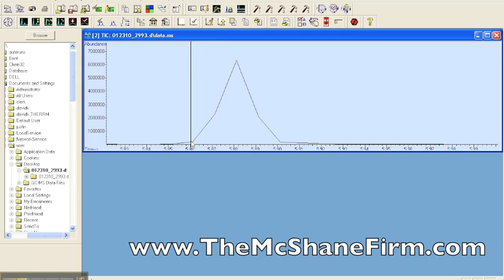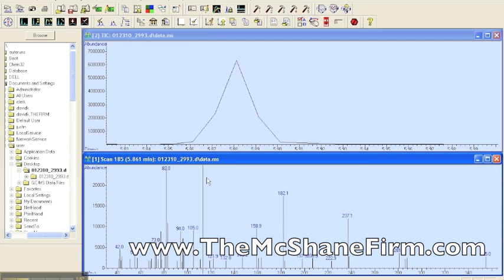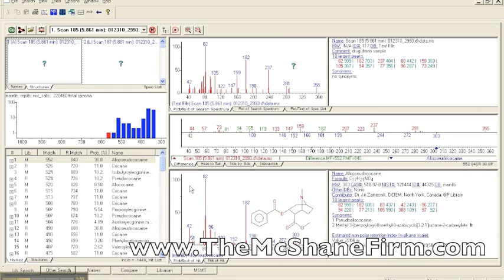So let's take some extreme positions. Let's say you're an analyst and you right double-click down here where there's clearly a peak and the beginning of the compound. We right double-click, and that comes up with the scan that's down below here. The next thing we do is right double-click to open up the NIST spectral library. Here's the histogram. As you can see, all the values are really low in terms of the match factors. And over here we have the hit list, the top 100 guesses that the algorithm comes up with.